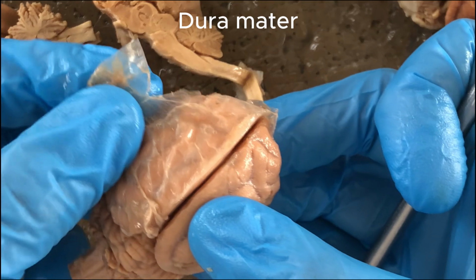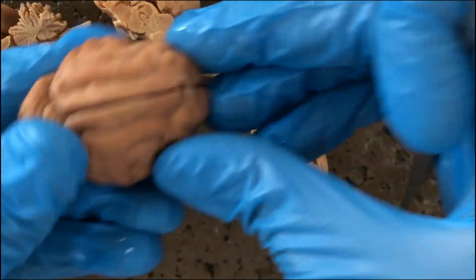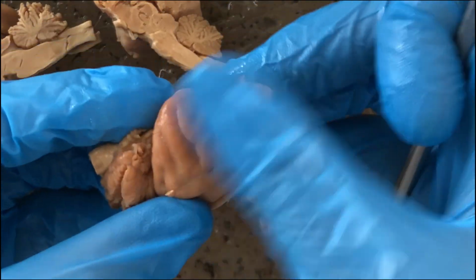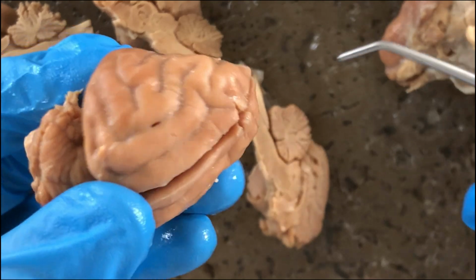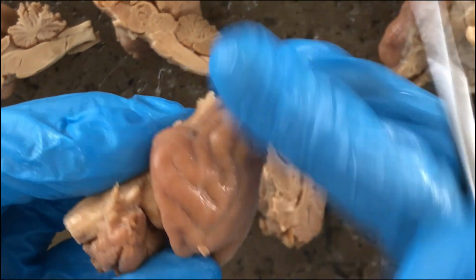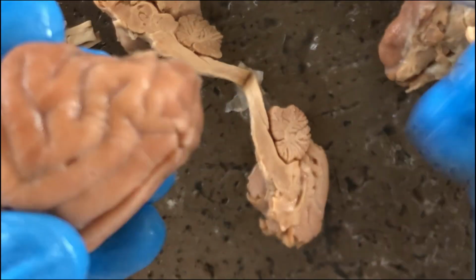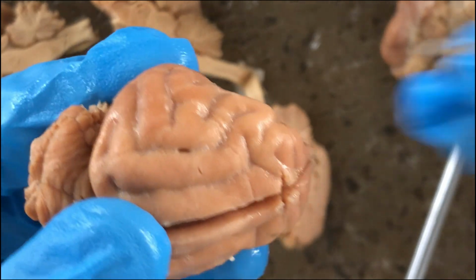This is the dura mater, and here you'll see that the dura mater has been removed, and the other 2 layers, the 2 deepest layers or meninges, are closely applied to the brain substance itself, and it's impractical to dissociate them.